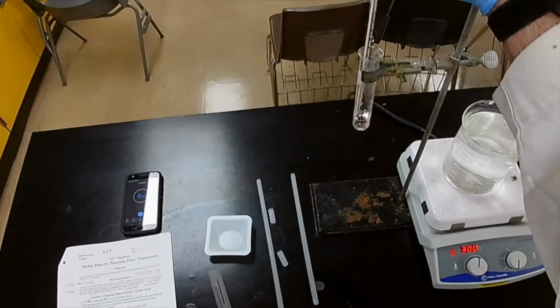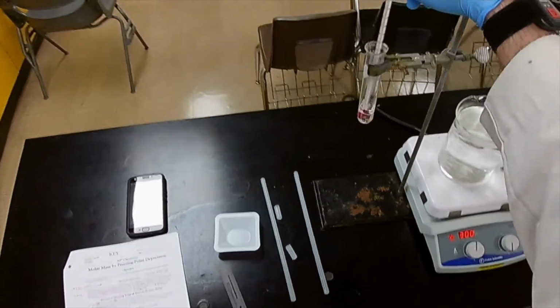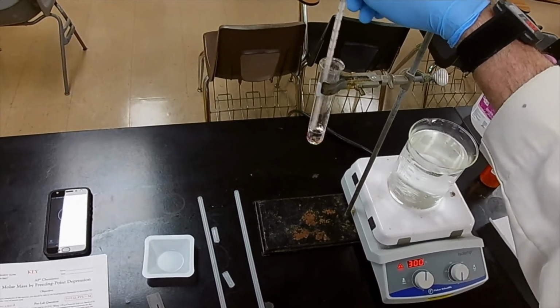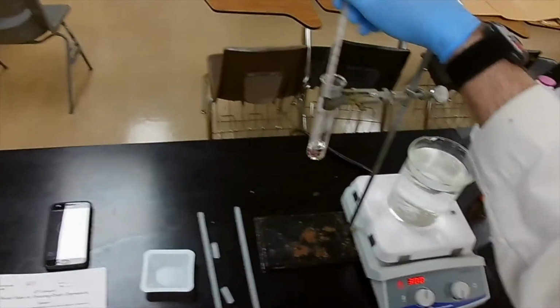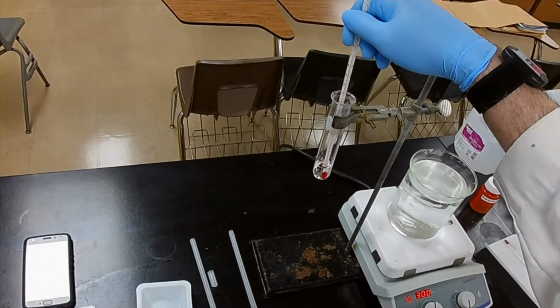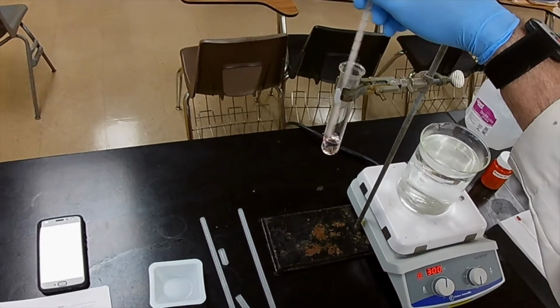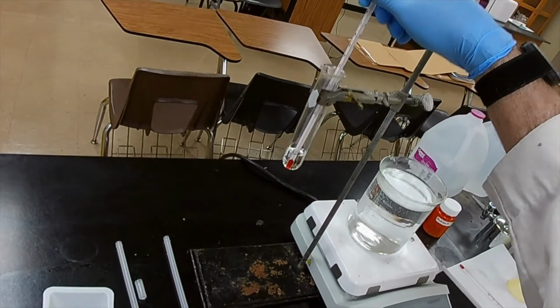We could start measuring now, but we'd take a lot of wasted measurements. The reason that the method says start measuring at 60 degrees is because the freezing point of lauric acid is less than 60 degrees, much less, in the 40 degree range. So if we start at 60, we have sufficient data without excess and wasted effort. Okay, we're on our way down to 70, still dropping.